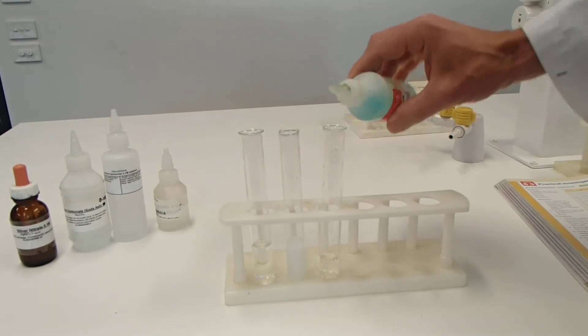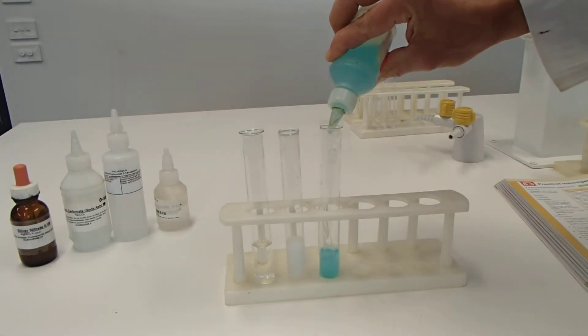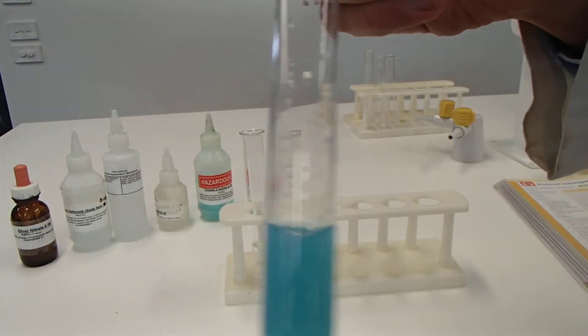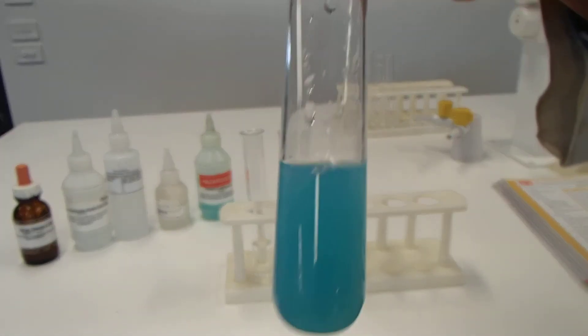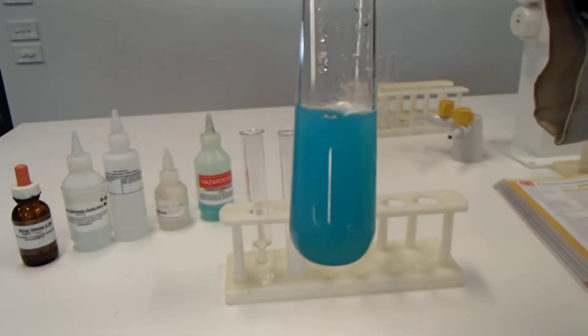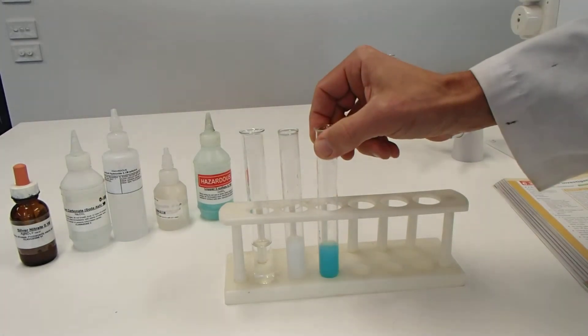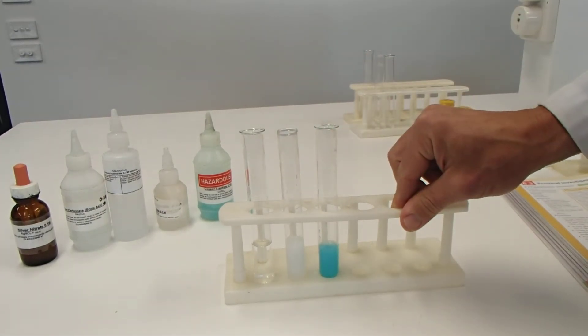Last of all, sodium carbonate and copper sulphate. You might have seen a significant change there. Not only did that colour become brighter, a brighter blue. I cannot see through that. That is what we call opaque. I can't see through that. Okay. So it seems like something has formed there.